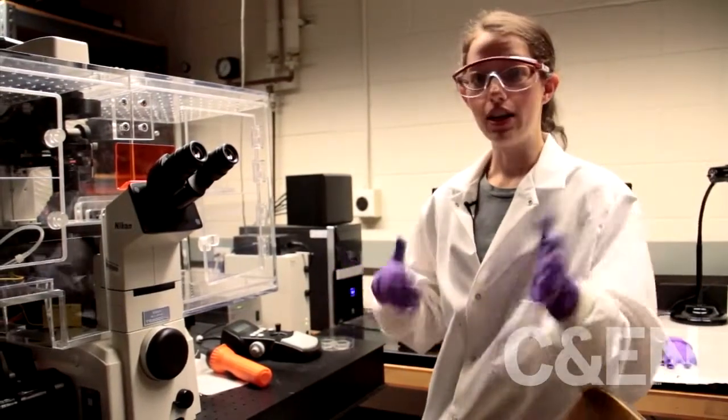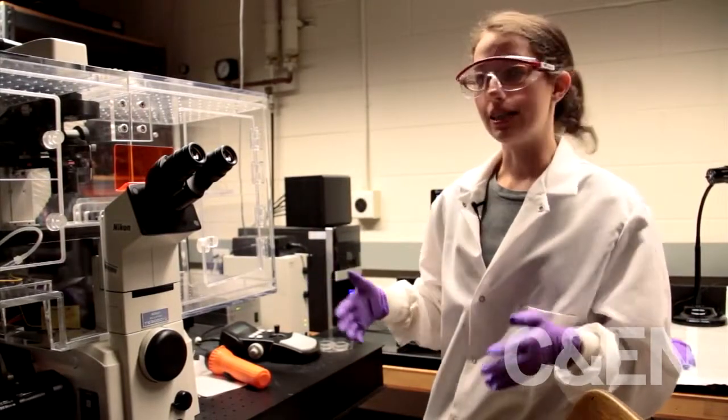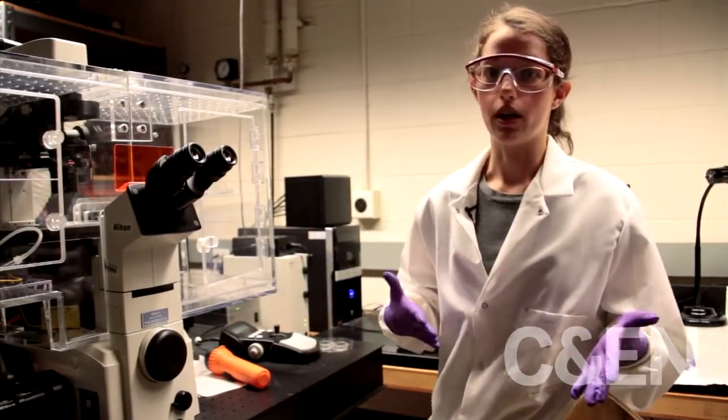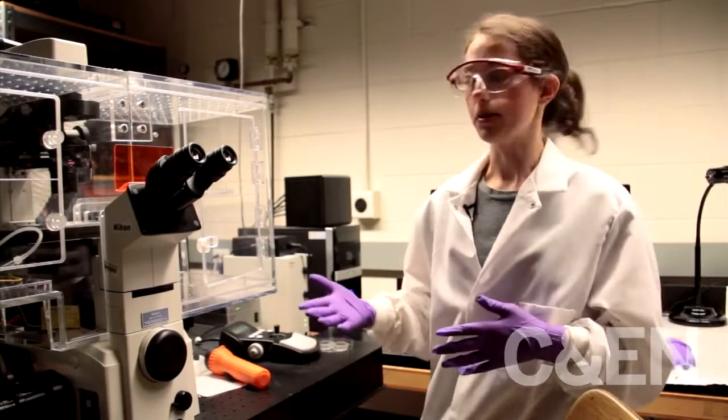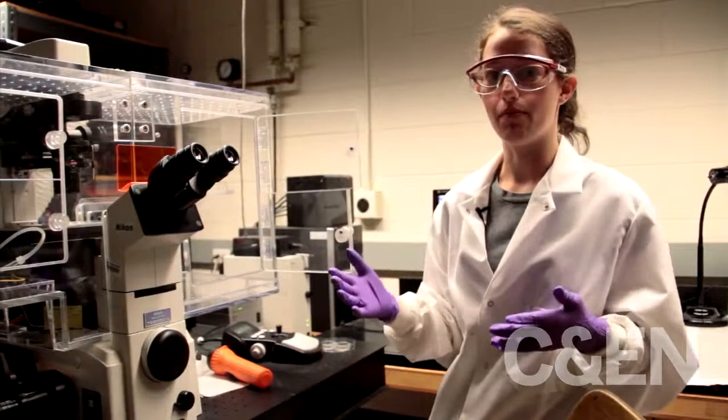And then we incubate the quantum dots with the cell lines and various different cell lines to see whether or not the quantum dots will adhere to the cells. And so here, when that's all finished, we look at them with the microscope.